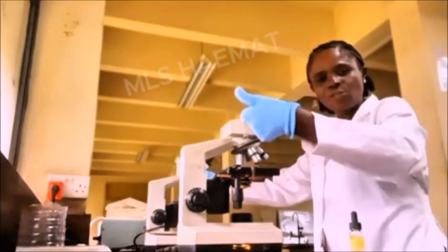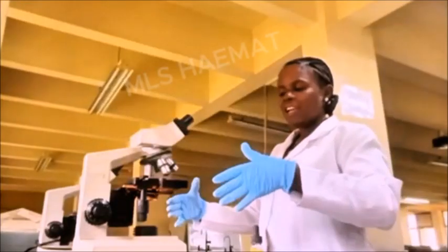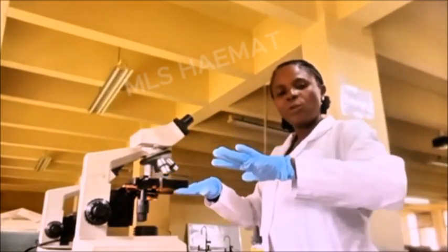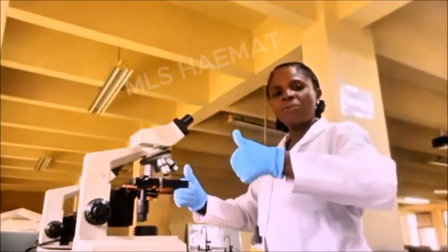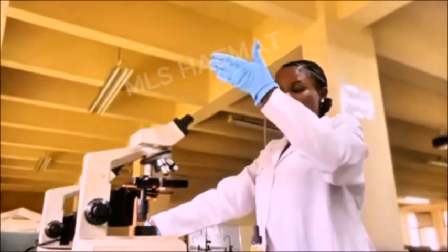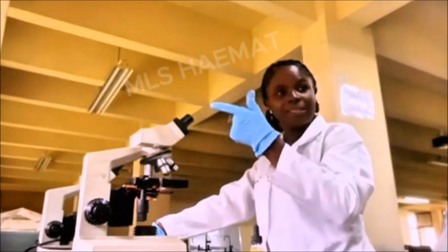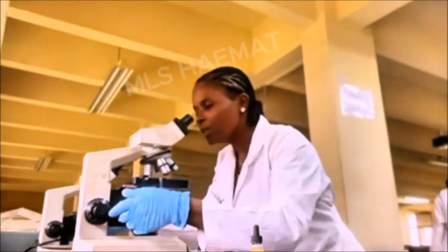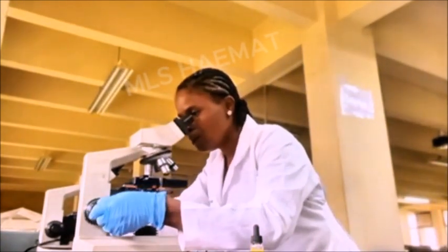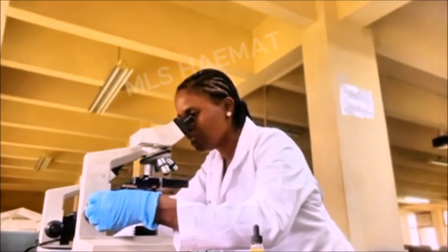I'll now start moving the fine adjustment towards my side, not to the front. Because as I'm moving it towards my side, the stage will be going down. But if I'm moving it forward, the stage will continue to go up. And that means it's touching the objective lens more. That can break the slide. So now I'll just start rolling the fine adjustment towards my side.